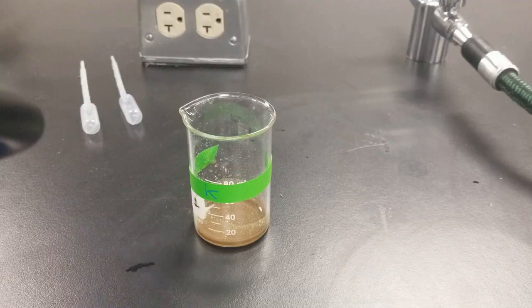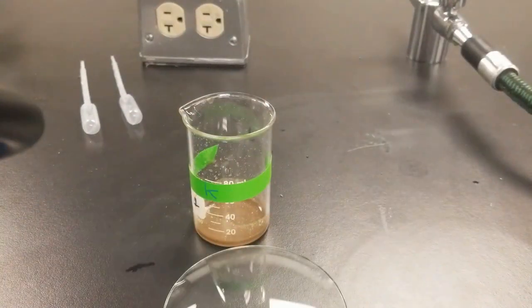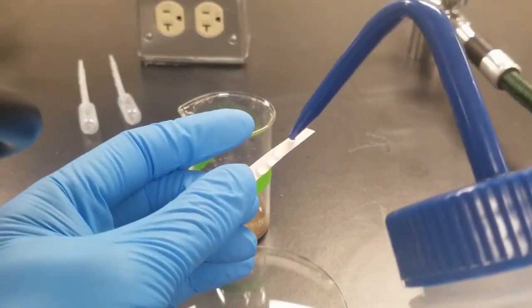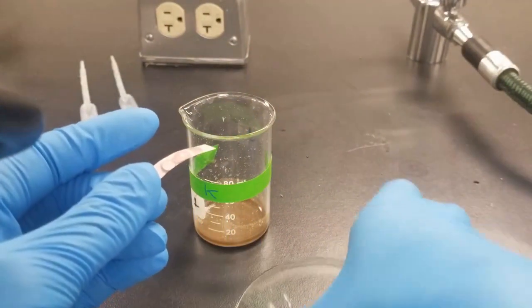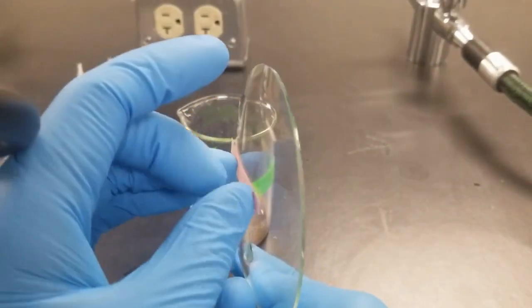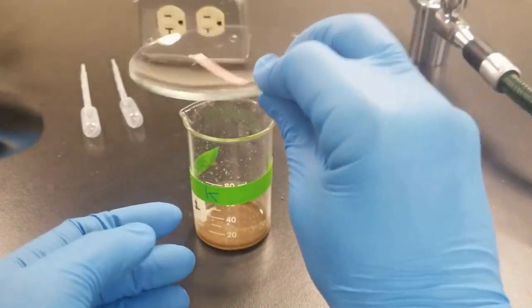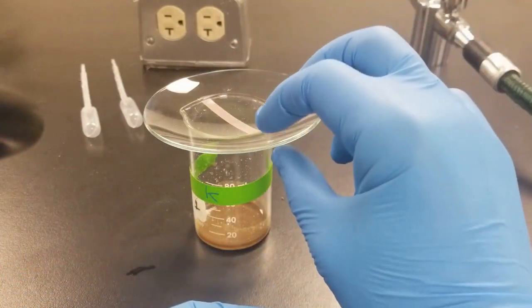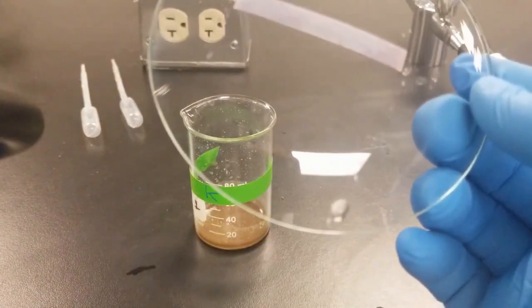I'm going to take a piece of litmus paper, my watch glass, moisten the litmus paper with some water. And then stick it on the kind of the convex side here. So just kind of press it on there. Cool. And then we're going to cover it up. And then we're going to gently heat and see if this piece of paper changes colors. You can see it doesn't really need heat. The change is already occurring.